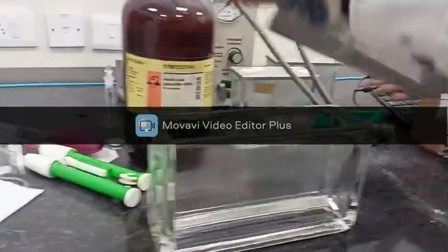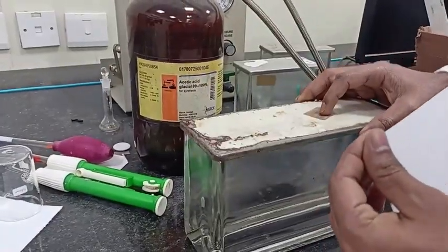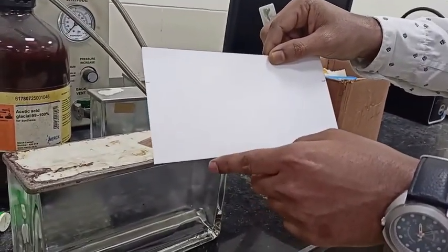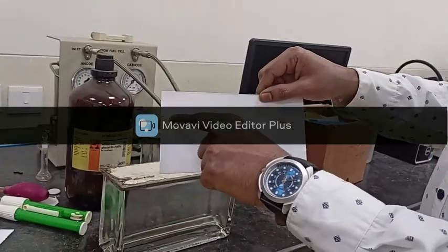Once the solution is ready, we will dip this plate inside the glass developing chamber, and we will keep it for some time so that the mobile phase, which is n-hexane and toluene, will travel to this distance. Once it reaches this point, we will dry the solvent using this dryer.